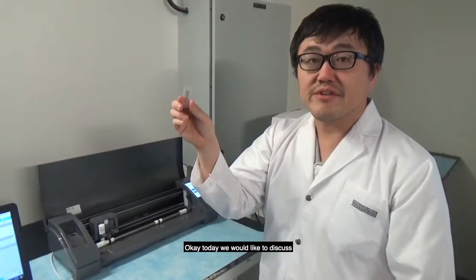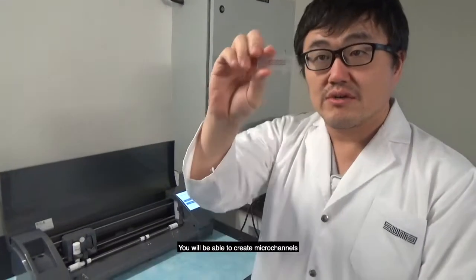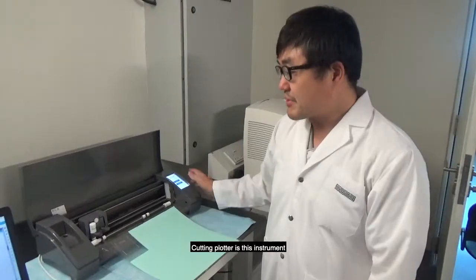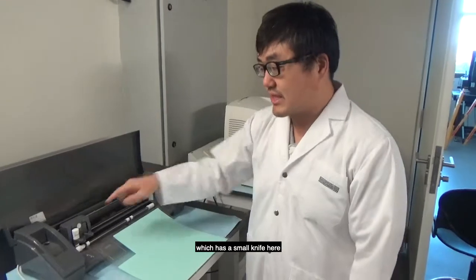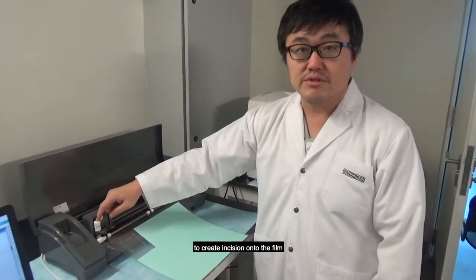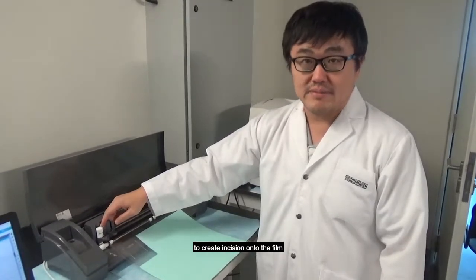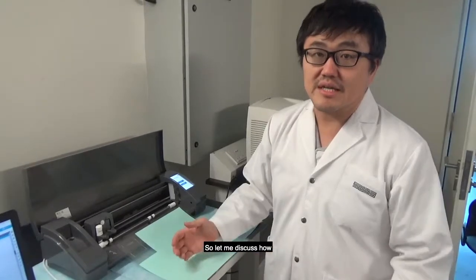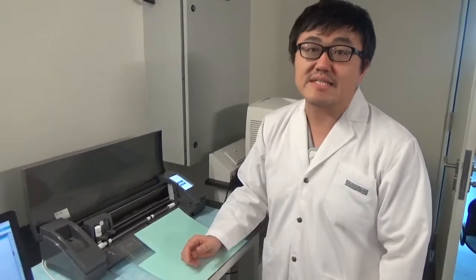Okay, today we would like to discuss how to create microchannels using a cutting plotter. You are able to create microchannels which are embedded in the film. A cutting plotter is this instrument which has a small knife here that is digitally controlled to create an incision onto the film. And using that, you can create a microchannel. So let me discuss how to do it step by step.